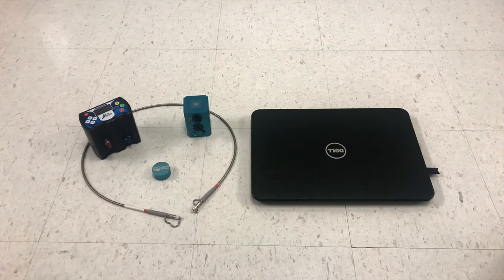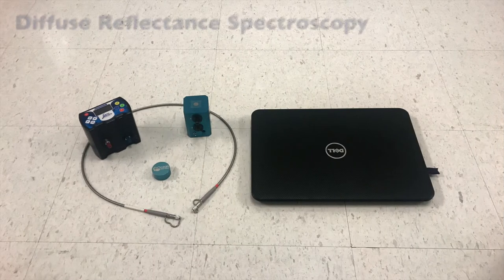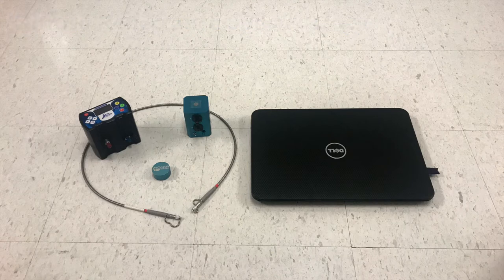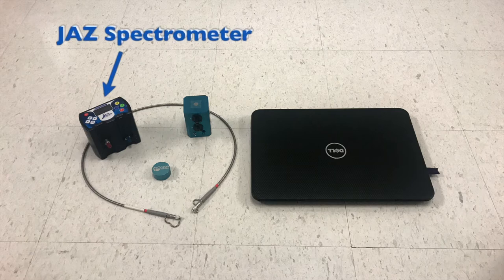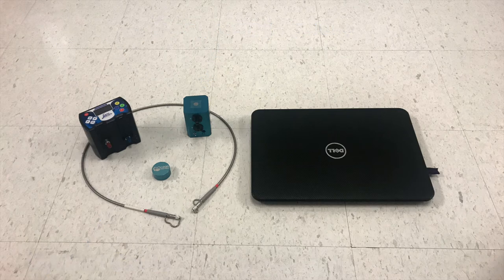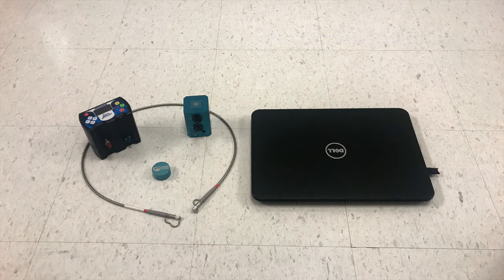Here we want to show how to study the photophysical properties of photochromic molecules using diffuse reflectance spectroscopy. For performing reflection measurements, we used a jazz spectrometer, an integrating sphere, an optical cable, a reflection standard, and a computer with SpectraSuite software.